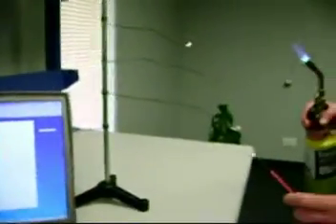The next technique that we'll be demonstrating is using a combustion technique. This is a very simple and low-cost way of demonstrating combustion and emission lines coming from combustion.